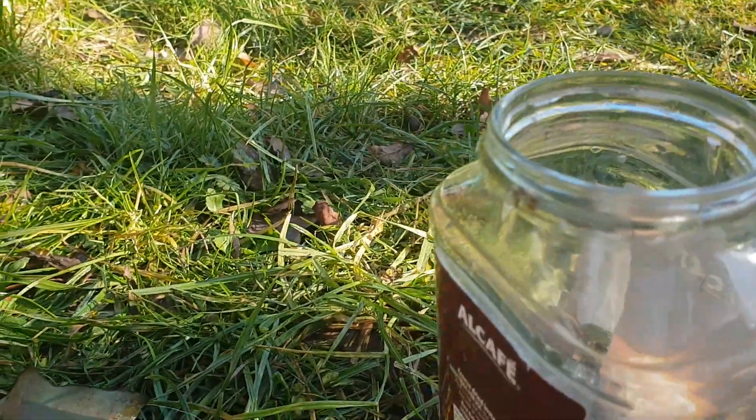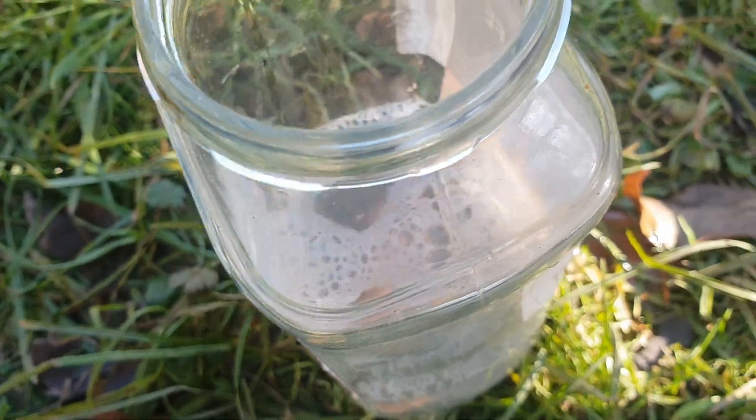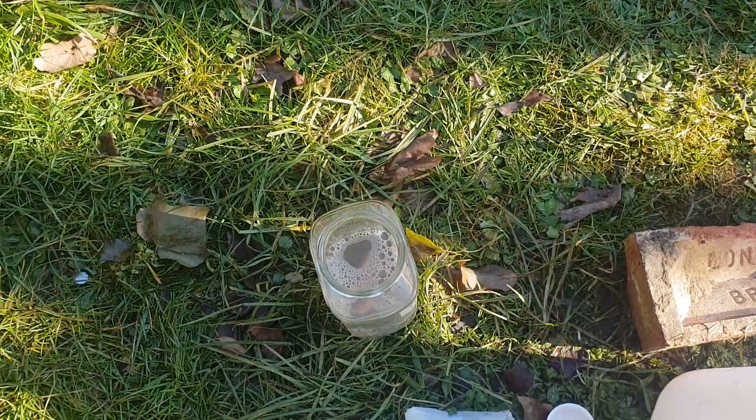There's the copper. When it goes bright again I'll take the copper out, re-burn it, and keep doing that. After two to three days that should be copper chloride. Come back in two to three days and I'll show you. Bye bye!